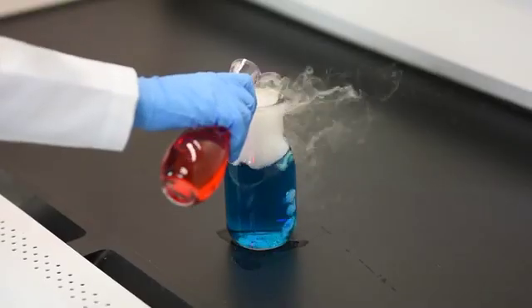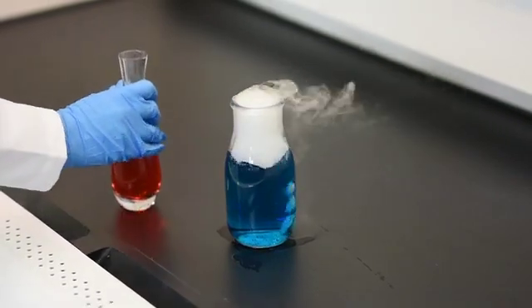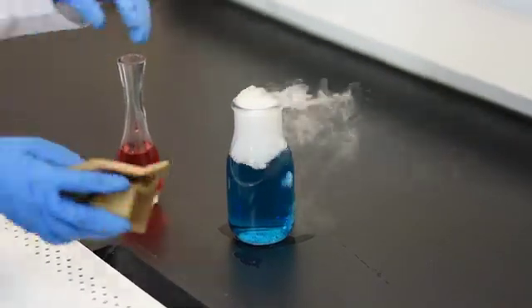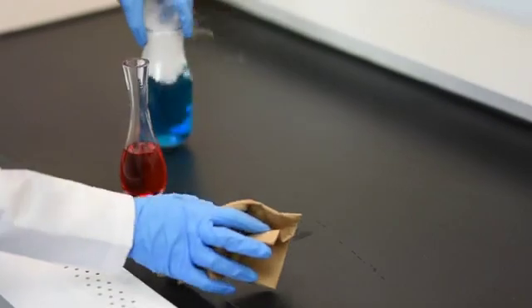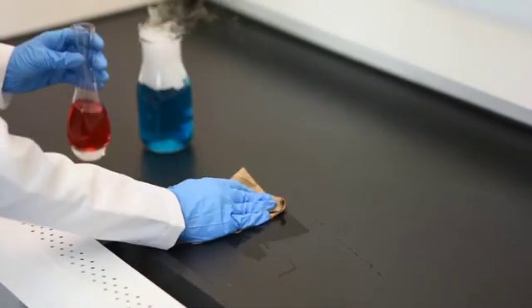If a spill does occur in your fume hood, it is important to move all of the chemicals away from the spill. It is also important to clean this area up thoroughly and immediately.